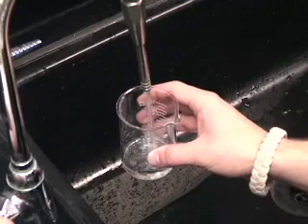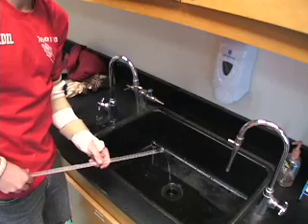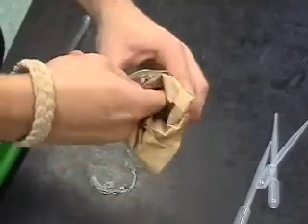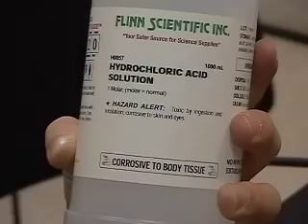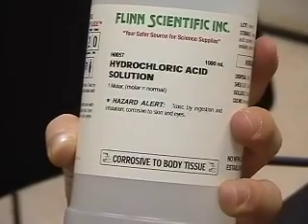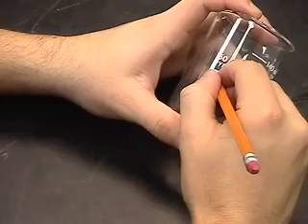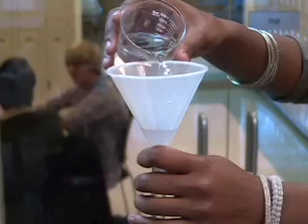So how do we conduct a titration? First, you want to make sure that all of your materials are cleaned thoroughly so that no contamination occurs. When doing a titration, even very slight errors can affect your results greatly. Then, after you've washed them, you want to make sure that they are dried. In the titration we're going to do today, we're going to be using one molar hydrochloric acid and a base of unknown molarity. After labeling your materials, you're going to fill one of your beakers with hydrochloric acid and then pour that acid into a funnel that leads into your burette.